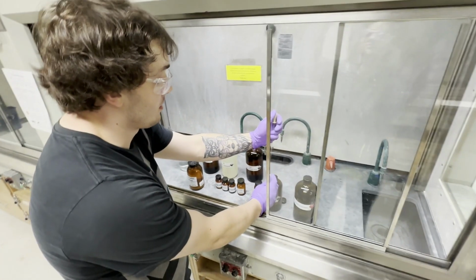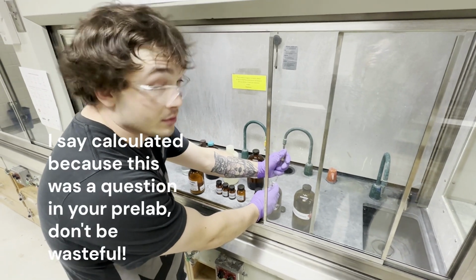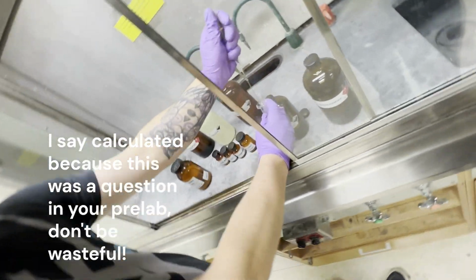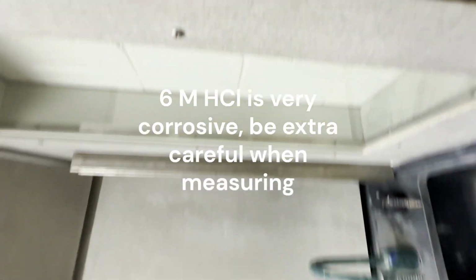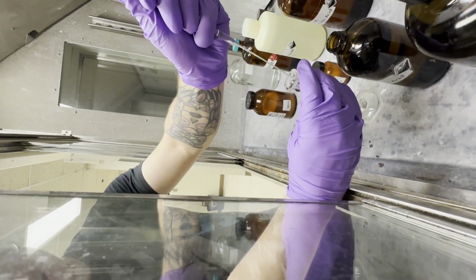All right, okay, is it ready? Yeah. Cool. All right, I'm now just measuring out the calculated amount of hydrochloric acid needed. You should have done this in your pre-lab. And we're going to use this to acidify our sodium hydroxide solution.